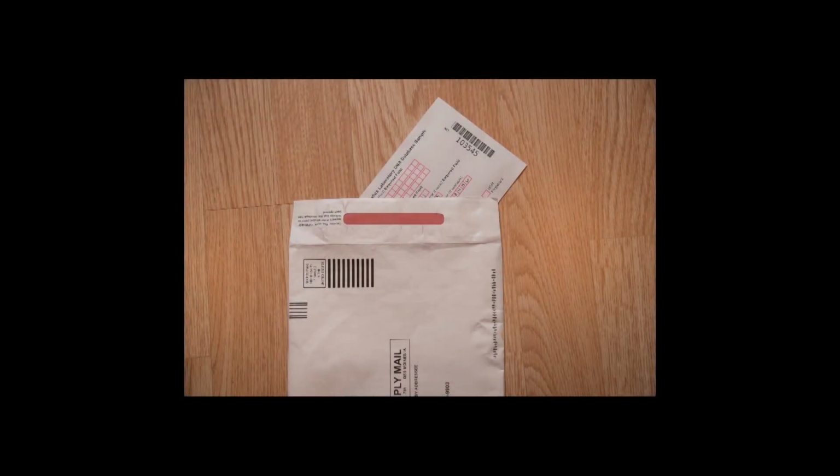Place the data envelope in the white shipping envelope and seal. The written instructions provided in the kit may mention a manila envelope and a shipping seal. Our current kit design does not contain these items. Promptly mail your collected offender sample to the laboratory for processing.